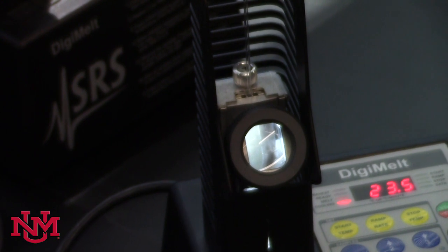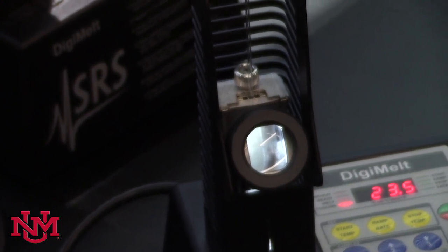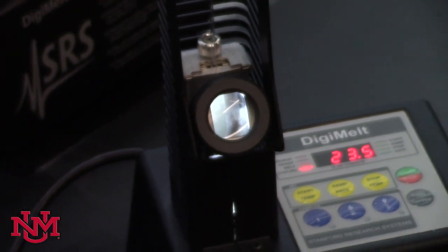The temperature at which the melting of the solid starts to turn into a liquid, and the temperature at which everything has turned into a liquid.